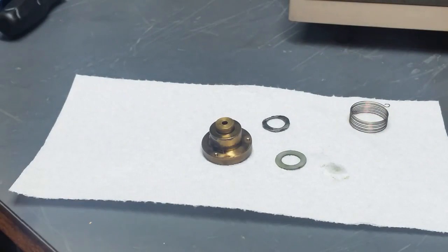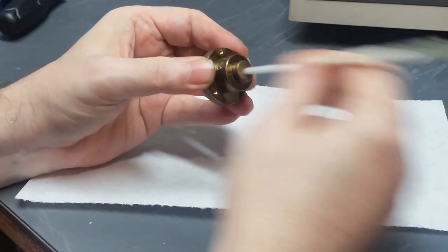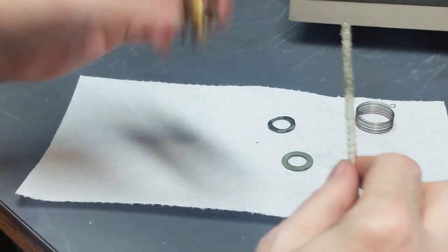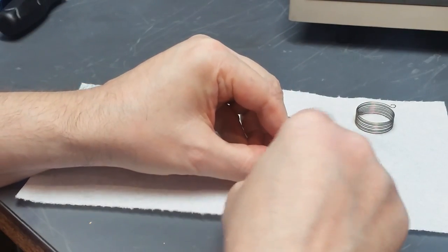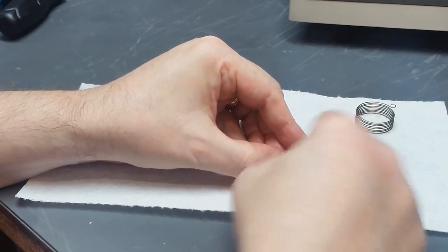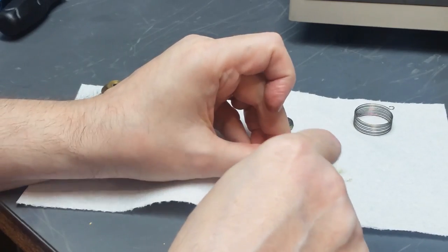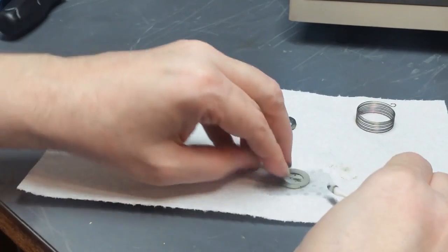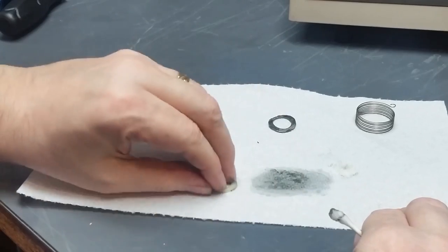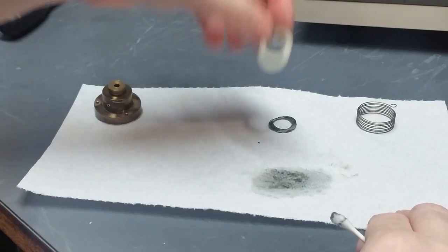Okay. And while I'm at it, I'm going to run this pipe cleaner with acetone on it through here just to make sure that there's nothing in that hole that shouldn't be in there. So this piece is now clean. Next, we work on the thrust washers. Oh, a little bit of grease on that. Let me try it this way. That works pretty well that way. Okay, I'm going to call that one done.